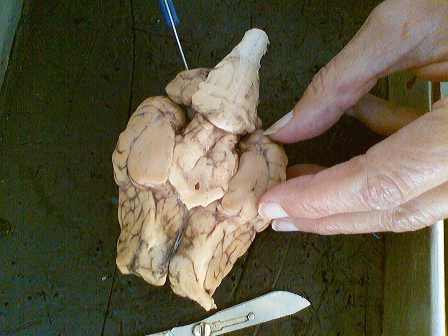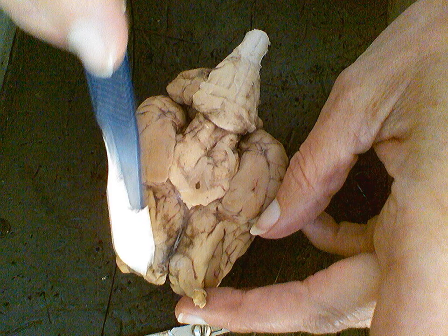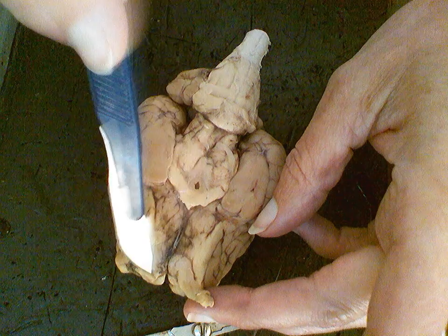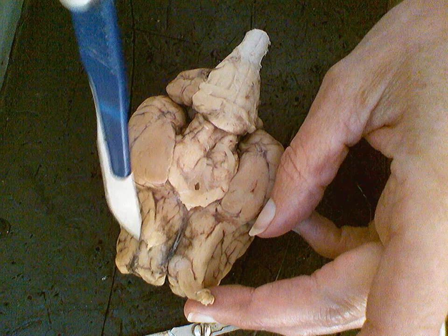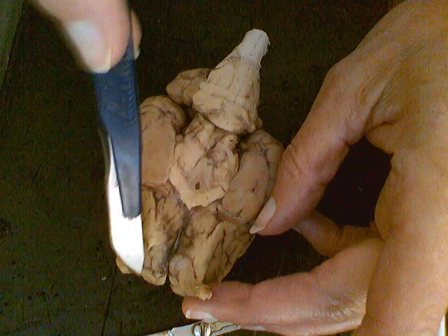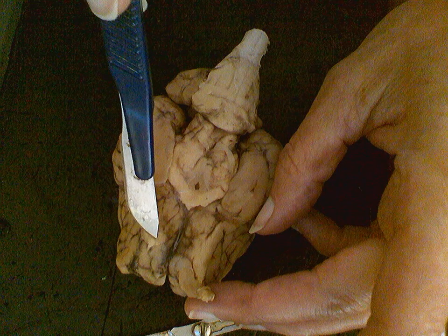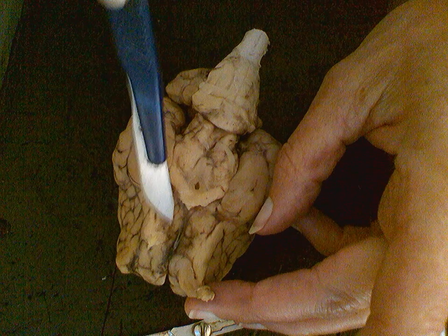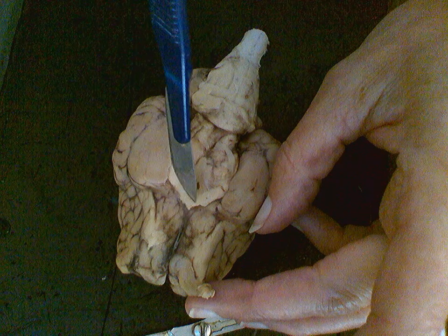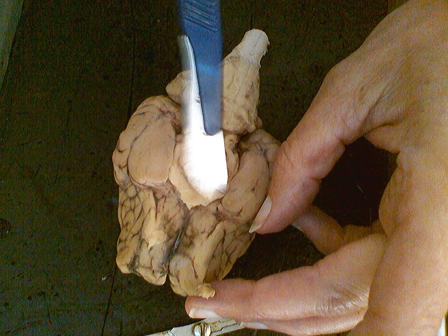A prominent feature on the basal side of the sheep brain are two white matter tracts. Remember that white matter has to do with a part of the neuron which has a kind of fatty coating on it. We're about to learn about that. But this is white matter, and this is called the olfactory bulb on both sides, which you know is responsible for the sense of smell. Continuing more medially and posteriorly, we're going back this direction, but kind of going more toward the middle. We see a cross here of white matter again. That white matter is a part of the optic tract and optic chiasm, which actually means cross.